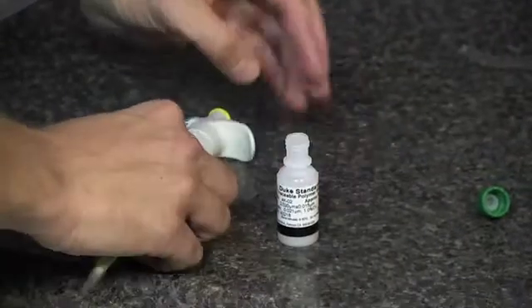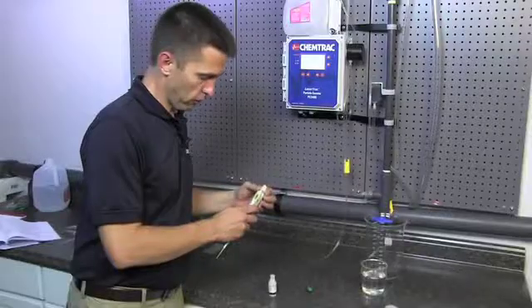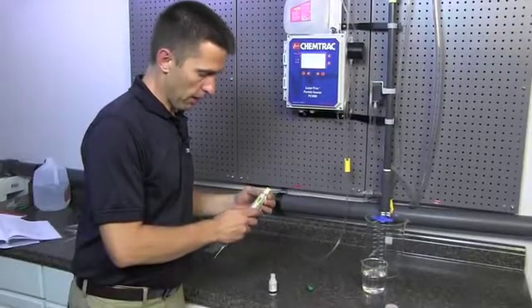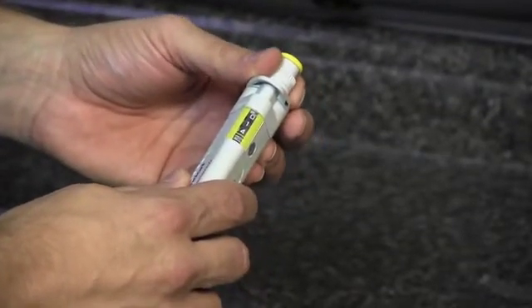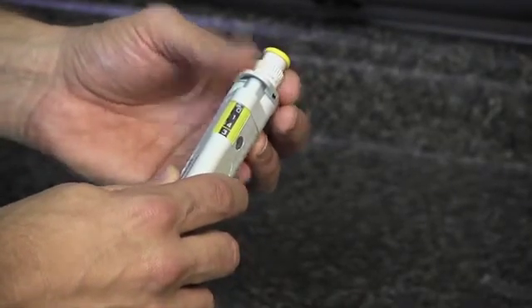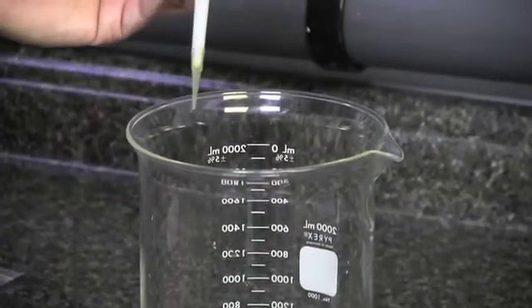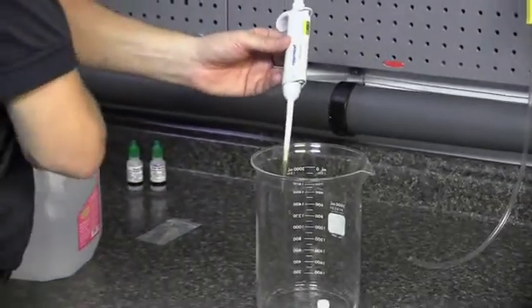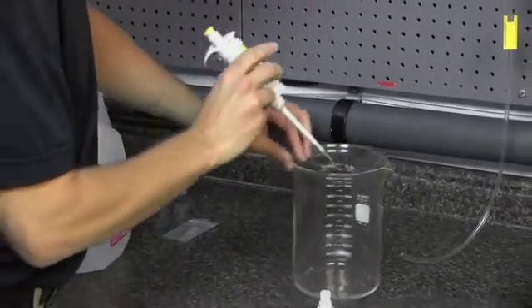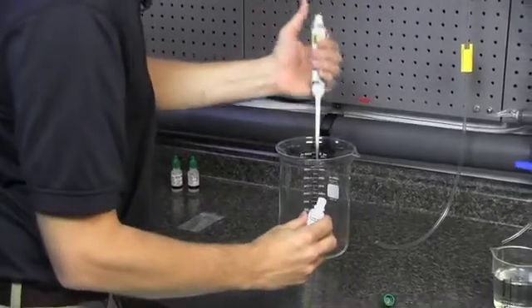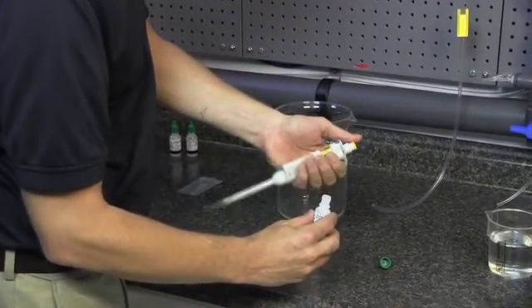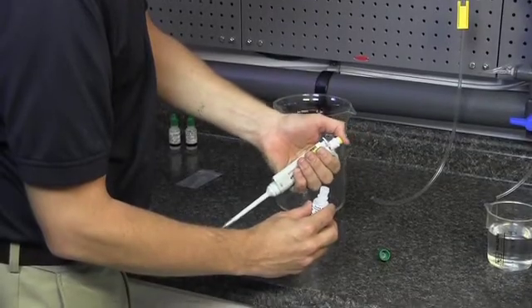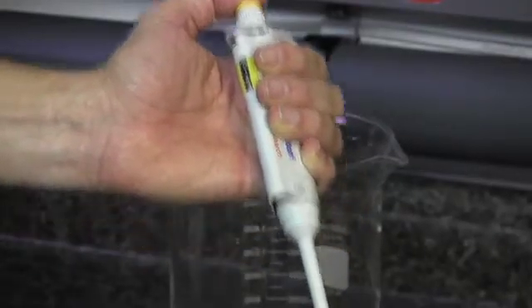Now, we're going to set our micro pipette for 14.3 microliters, which was the volume that we determined from the table in the calibration procedure. And then we're going to take this tip and just quickly rinse off the tip. And then we're going to take the plunger on the pipette, push it to the first stop, not the second stop, but the first stop.